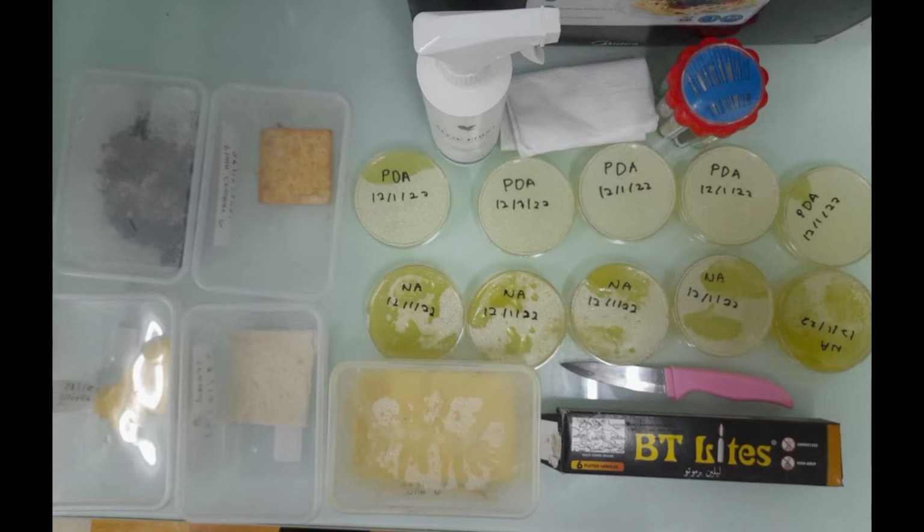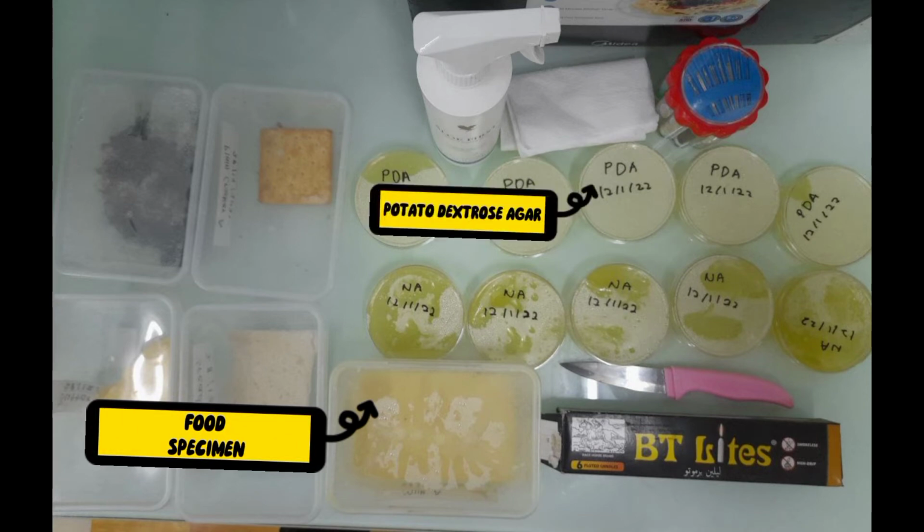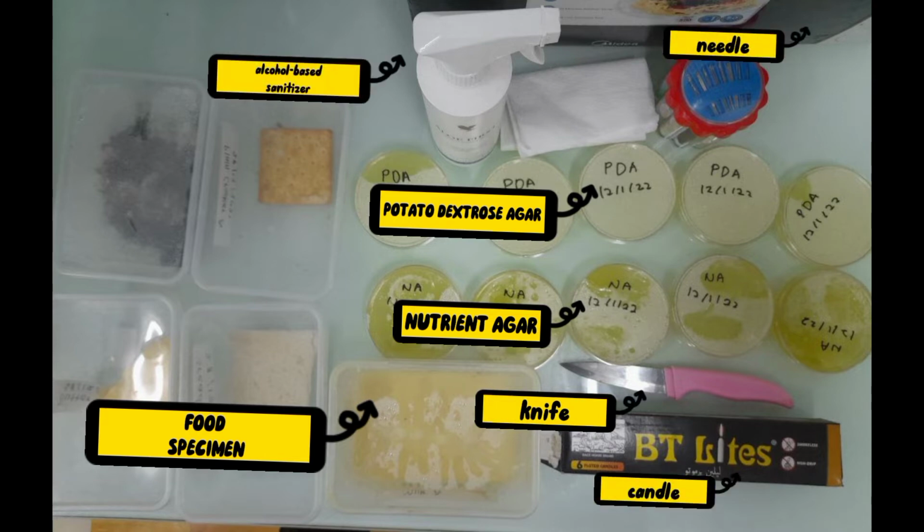For this last part, which is cultivation of microbes onto solid media, we require the experimental food specimen from part 1, potato dextrose agar and nutrient agar that we have prepared before. We also require a sharp pointed knife, a needle, a candle, an alcohol-based sanitizer, and lastly, a kitchen tissue paper.